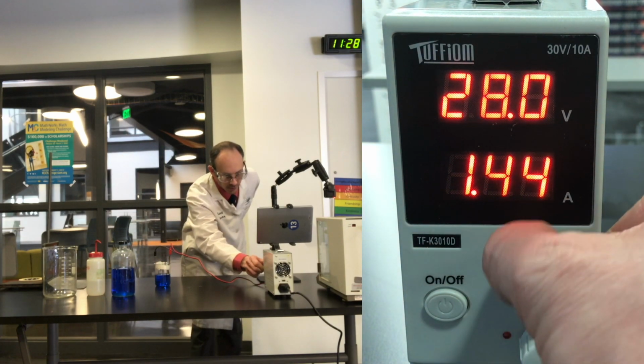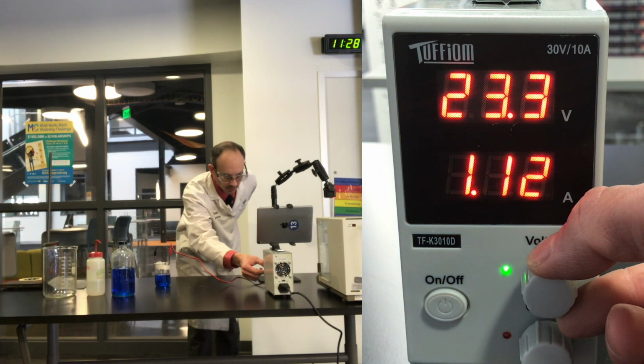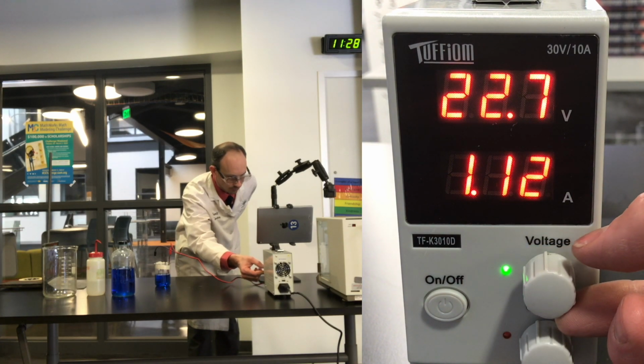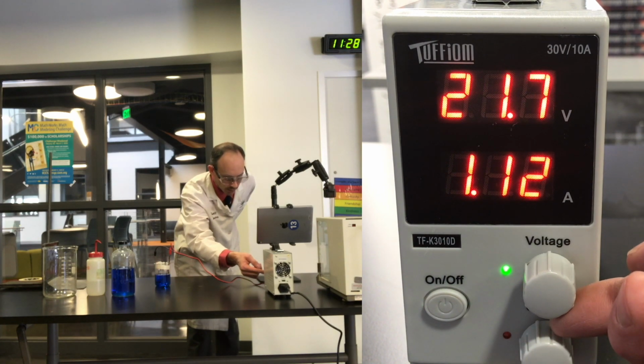All right, I'm going to kick this back down because I don't want it to go too crazy on us. I'm just going to try to keep it around 1.1.